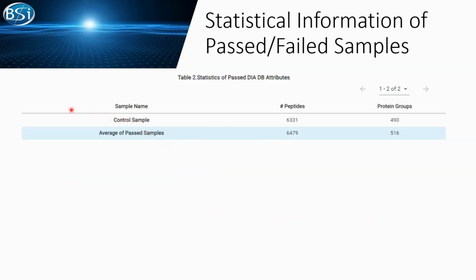Here is a comparative view of our control sample and the average of the passed samples. In our control sample, there are over 6,300 peptides, but the average of our passed samples nearly reaches 6,500. So my passed samples are beyond the threshold, and my passed samples are good. But what about my failed samples?